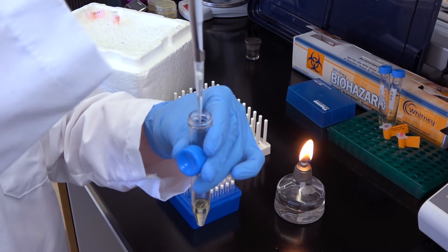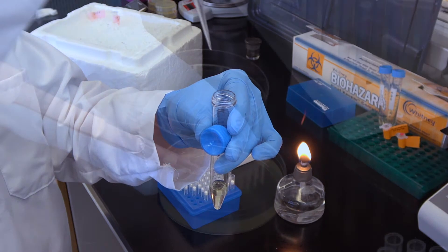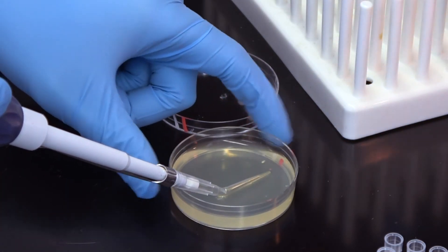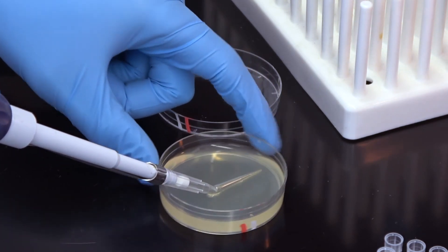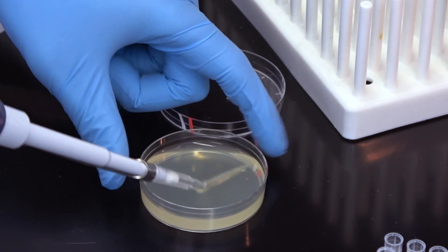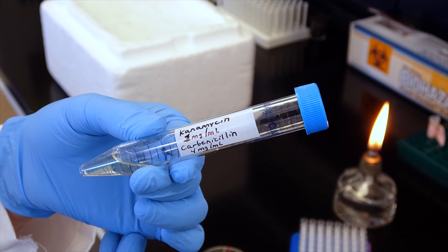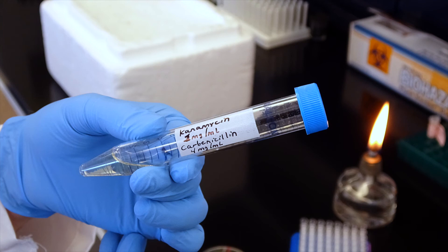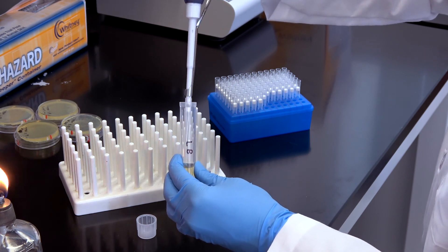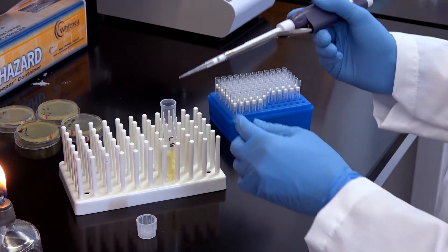When you are first determining the concentration of antibiotic to use for the over-agar method, you should also spread your transformants on a control plate that has the appropriate amount of in-agar antibiotic. This will tell you if you used too much antibiotic or if the transformation just didn't work. Please note that it is possible to use this method to add multiple antibiotics to a single plate, but you should always determine the appropriate concentration of each antibiotic empirically first, as the concentration required will be different for each antibiotic.